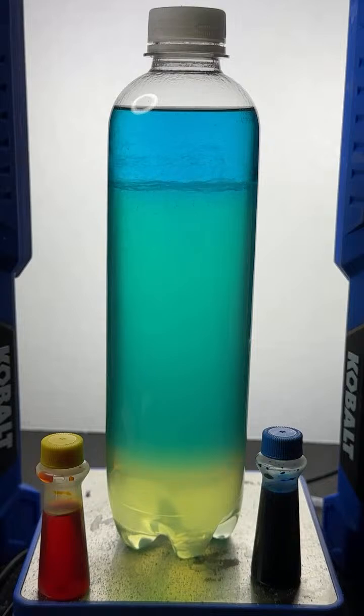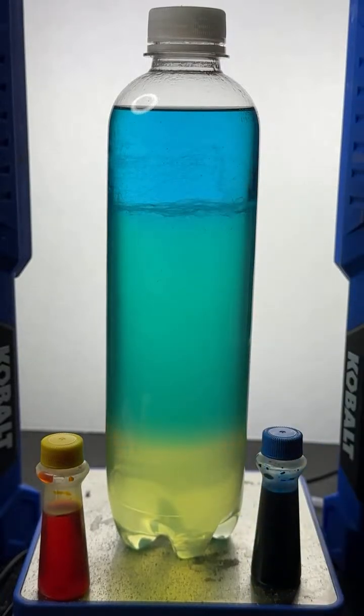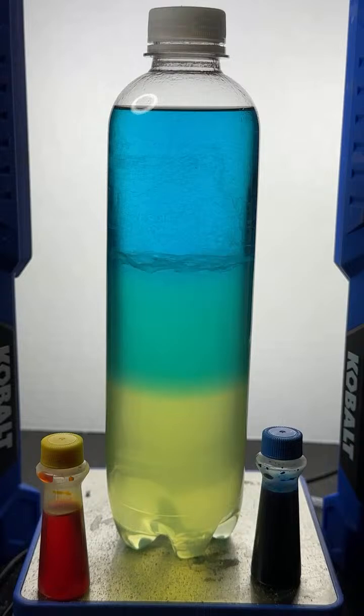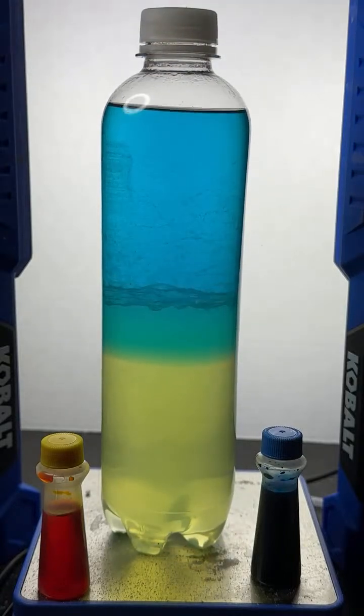At the start, we had an interaction. Boy, that separation is really looking gorgeous right now. At the beginning, we had alcohol and water, and they were mixed because they had some attraction for one another. Those molecules were attracted to one another, but the attraction was, we'll just say, tenuous, kind of weak. It was there, but it was kind of like a couple that's together, but they don't really know if they're in love or not.